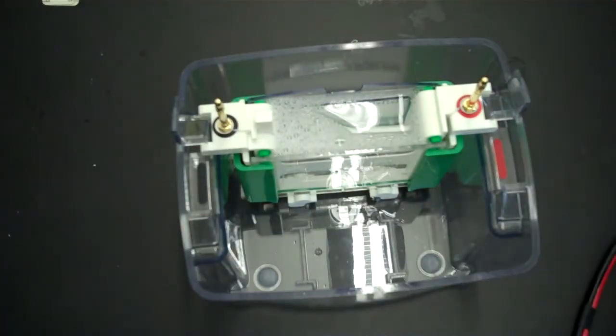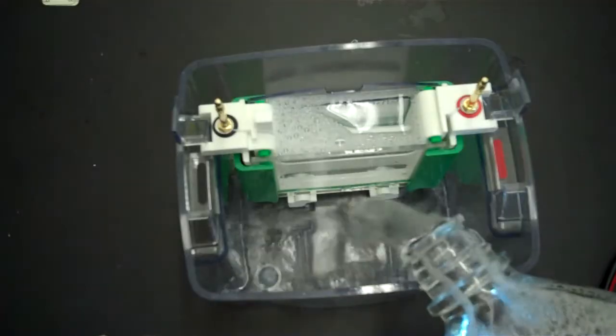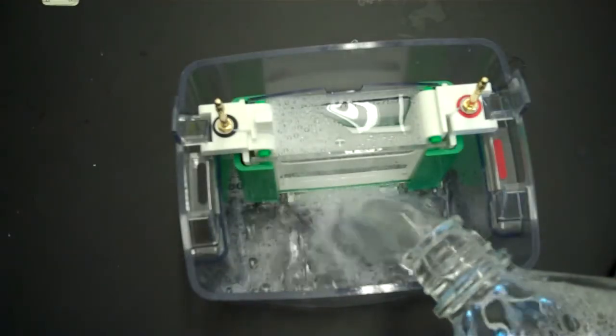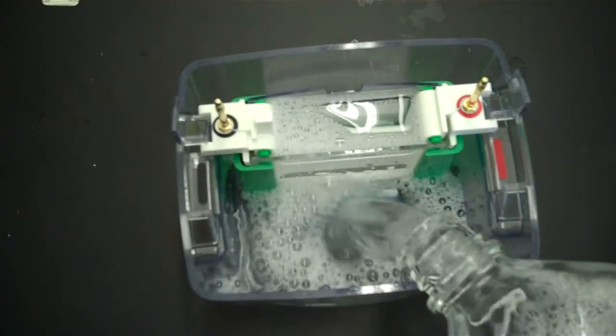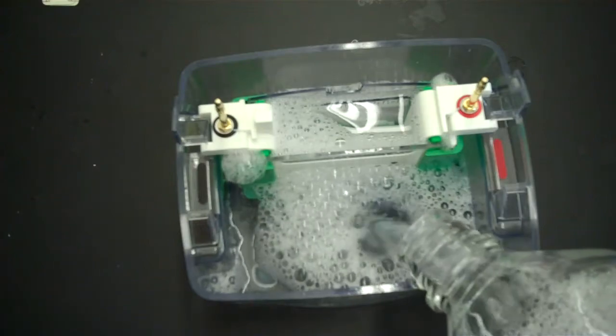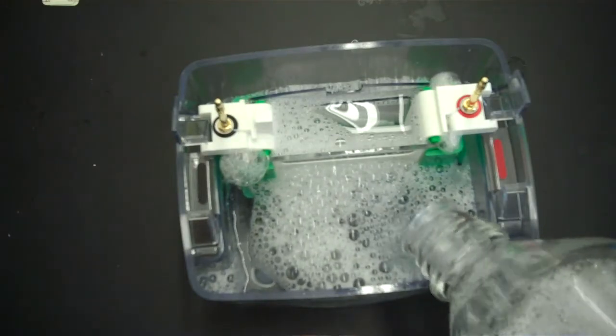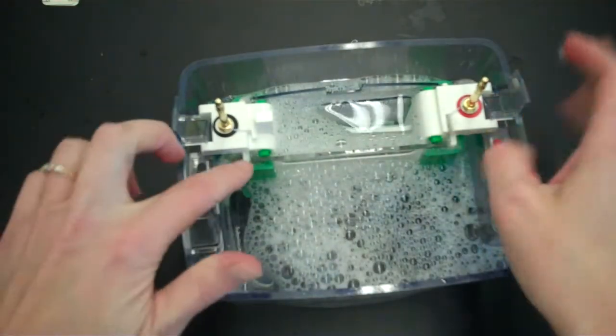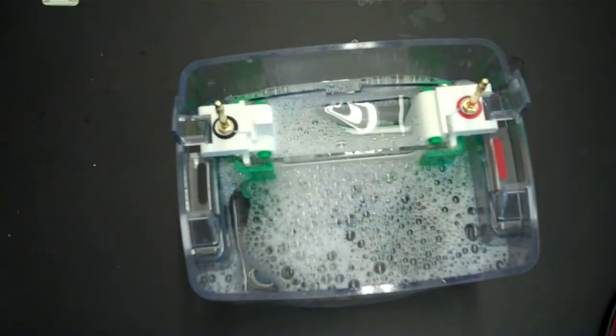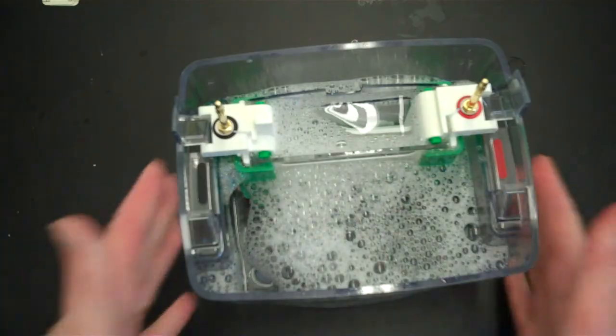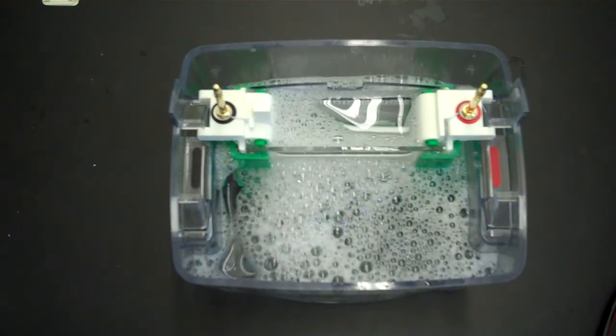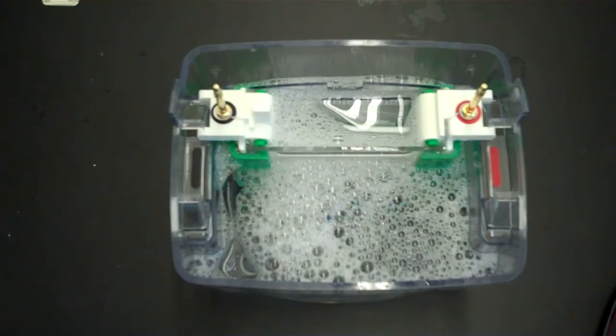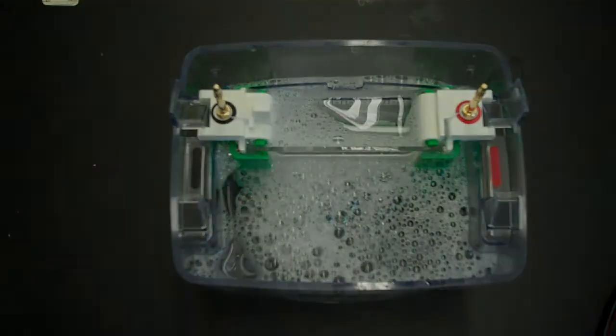But it is not overflowing into the outer chamber. And then you just take the rest of it and fill the outer chamber. So now your electrophoresis box is assembled and the buffer is in. And you are ready to load your samples.